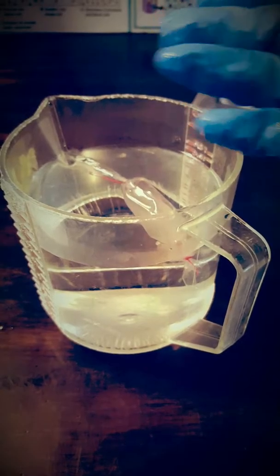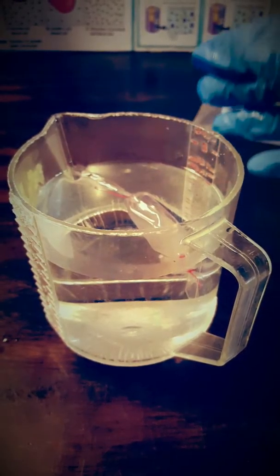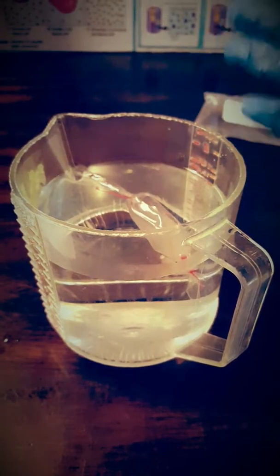And that, my friends, is basically all. You just have to wait about 20 to 30 minutes, take your weights and take your differences, and that will prove, my friends, that water moves from hypotonic to hypertonic solutions. And that's it. That's your experiment for osmosis, cellular transport.